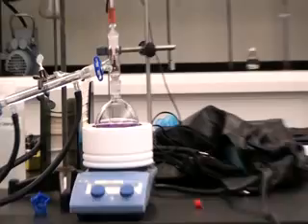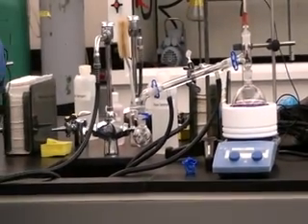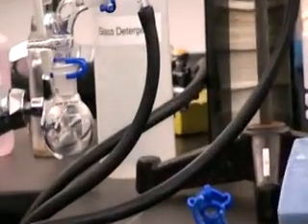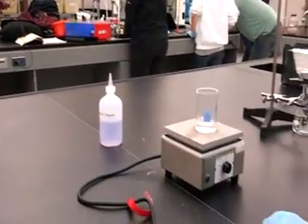After isolation by filtration, the damp product is reduced with sodium hydrosulfite in basic solution. After heating to complete the reaction, the base is neutralized with acetic acid. On cooling, the product, luminol, crystallizes and is isolated by filtration. In addition, we will also be performing a light-producing reaction with luminol.